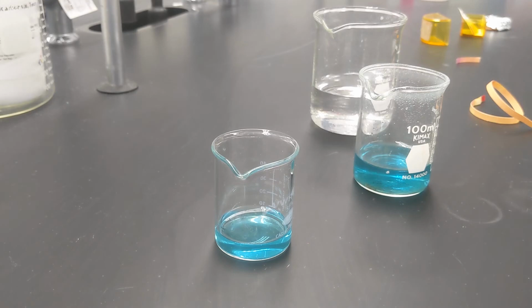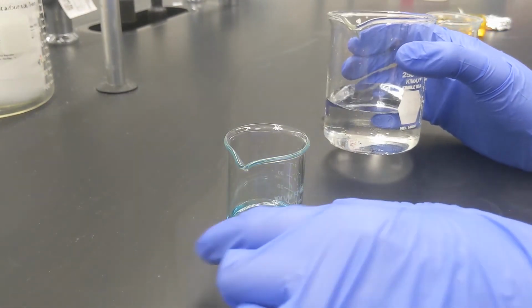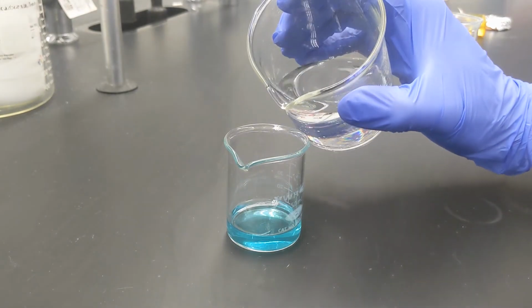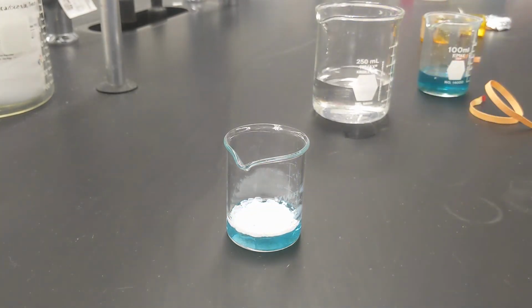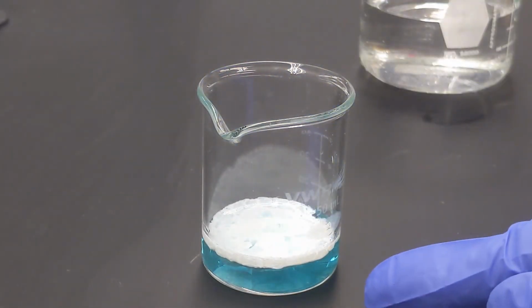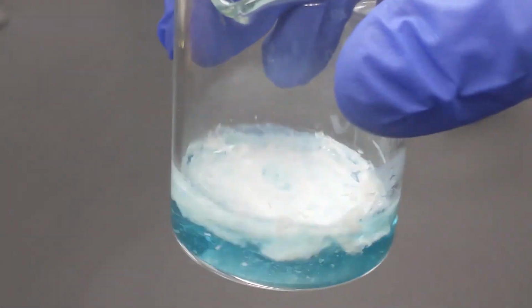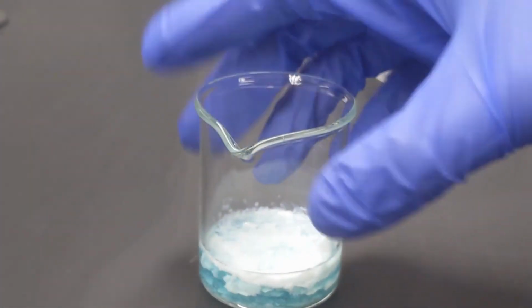So now what I have is the silver nitrate and copper nitrate, and I have various other impurities in solution. And to precipitate out something that's pure silver and not everything else, I can add some sodium chloride. So I have a small sample of that in here, my sodium chloride solution, and then I've got my silver nitrate, and I can just add a couple drops. And you can see right away we get this nice, beautiful precipitate forming. And this right here is the silver. This is actually silver chloride. And silver chloride is pretty much totally insoluble, so it's a good way to separate it from the copper.